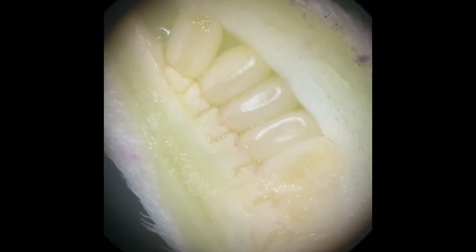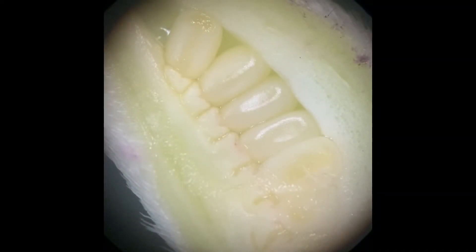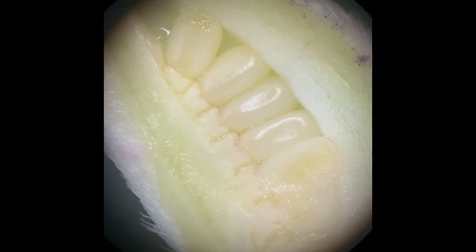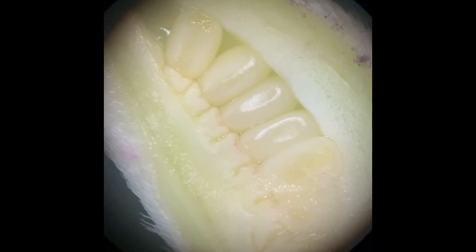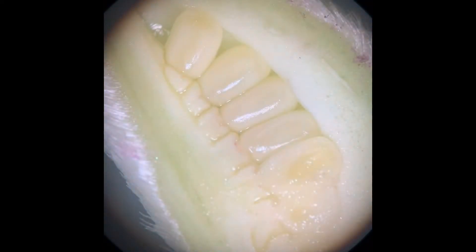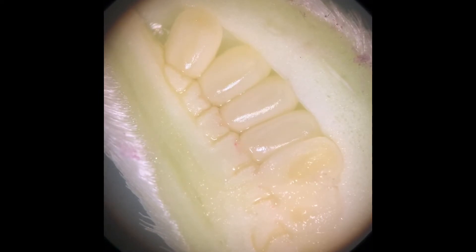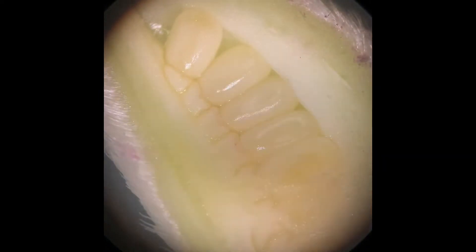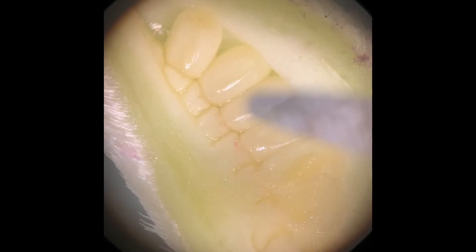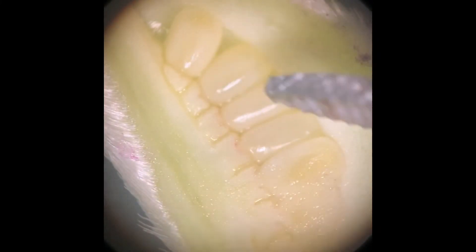I took the ovary that we had cut in half and placed it underneath the stereomicroscope. This is what the ovules look like up close and personal. If you look right here, these circles are the ovules.